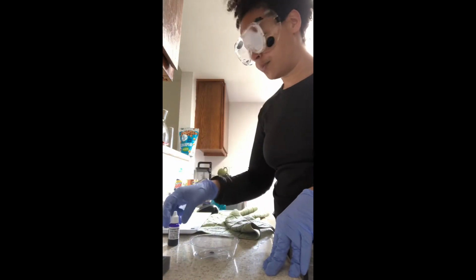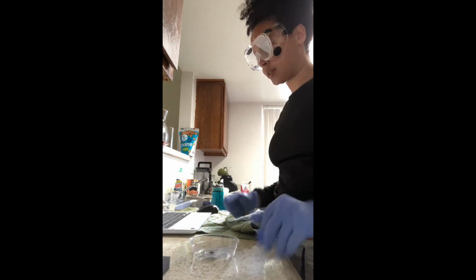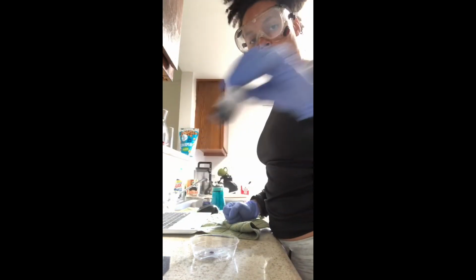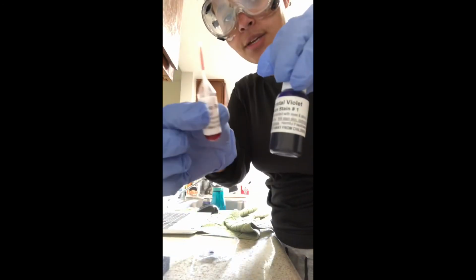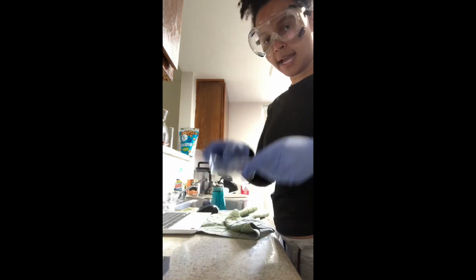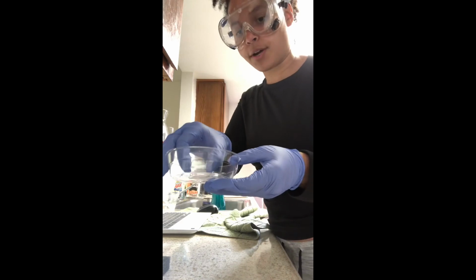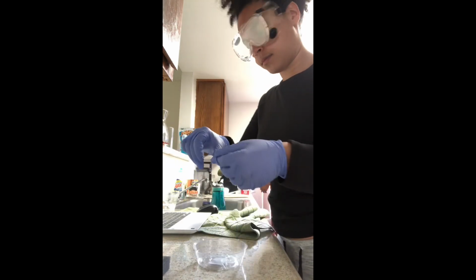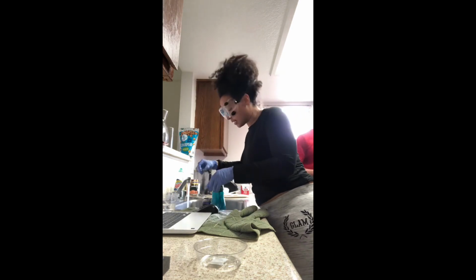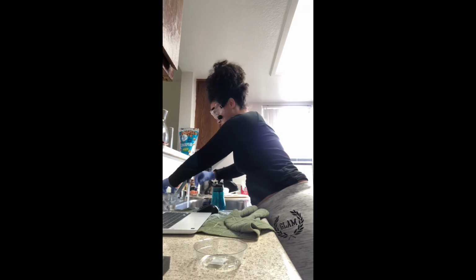it should both be viewed underneath the microscope. We're almost there, about 30 more seconds. And this is pretty much what I used. I will then take my slide and run it under tap water until it runs clear.